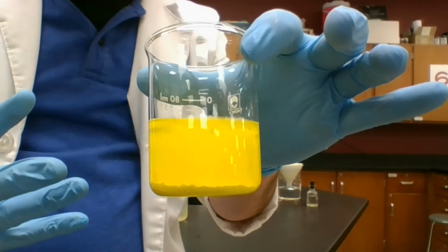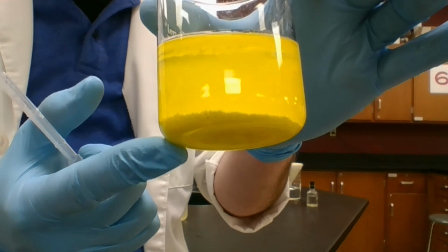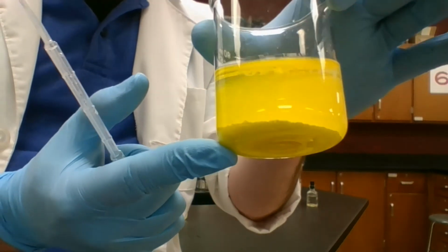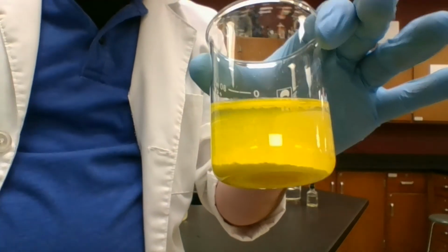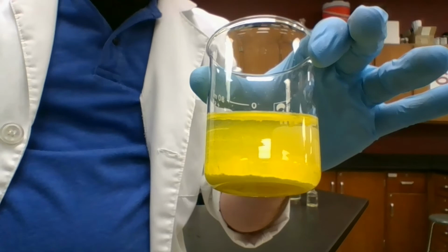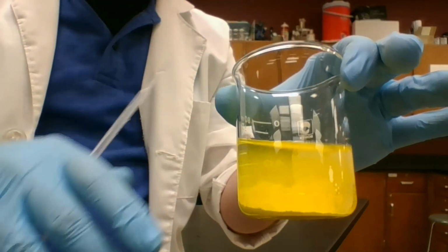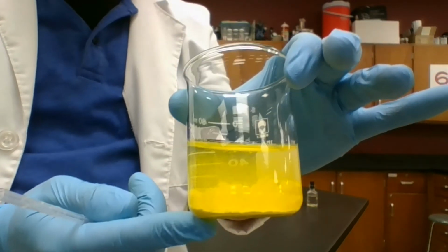we're mixing. Now you might notice that this yellow stuff has settled at the bottom here, which is a little interesting. That's actually a solid. We put two liquids together and we got a solid. We call this precipitation. If you think of it like rain, rain precipitates out of the sky. It's like a liquid coming out of a gas. In this case, we've got a solid raining out of a liquid, which is kind of wild.